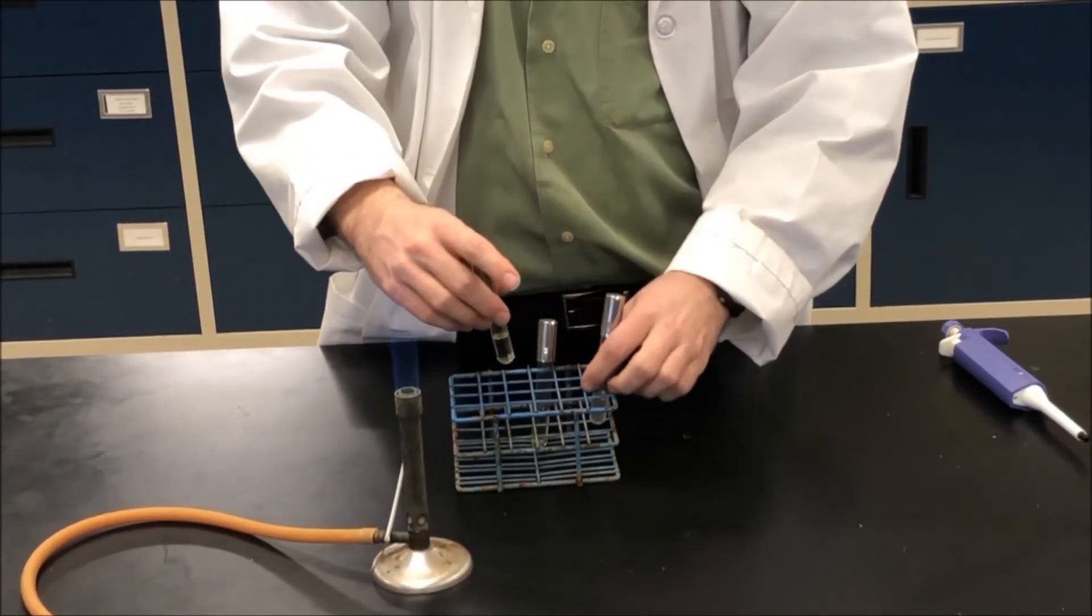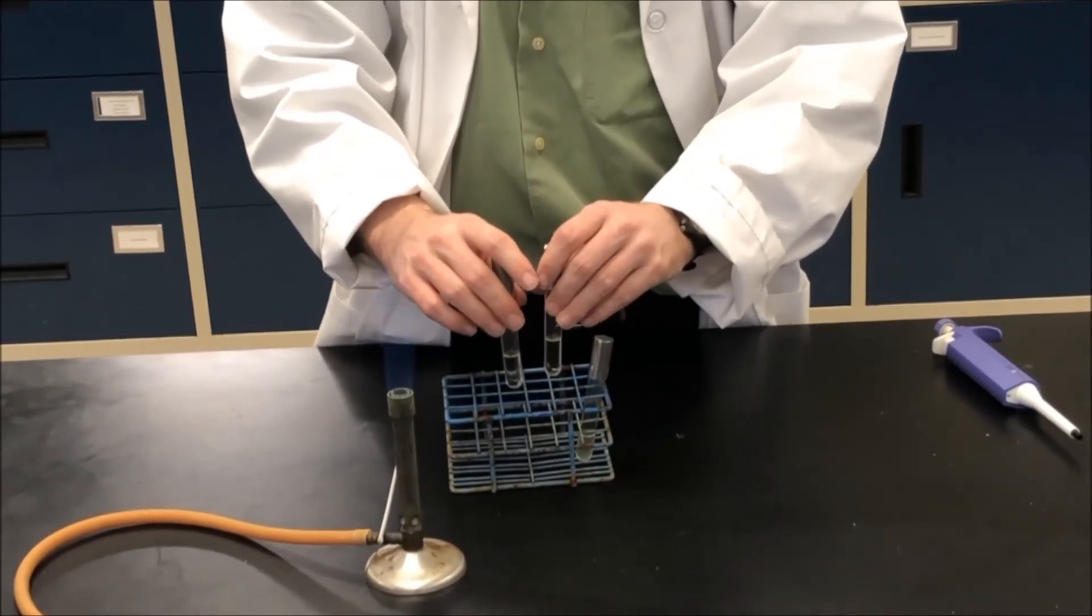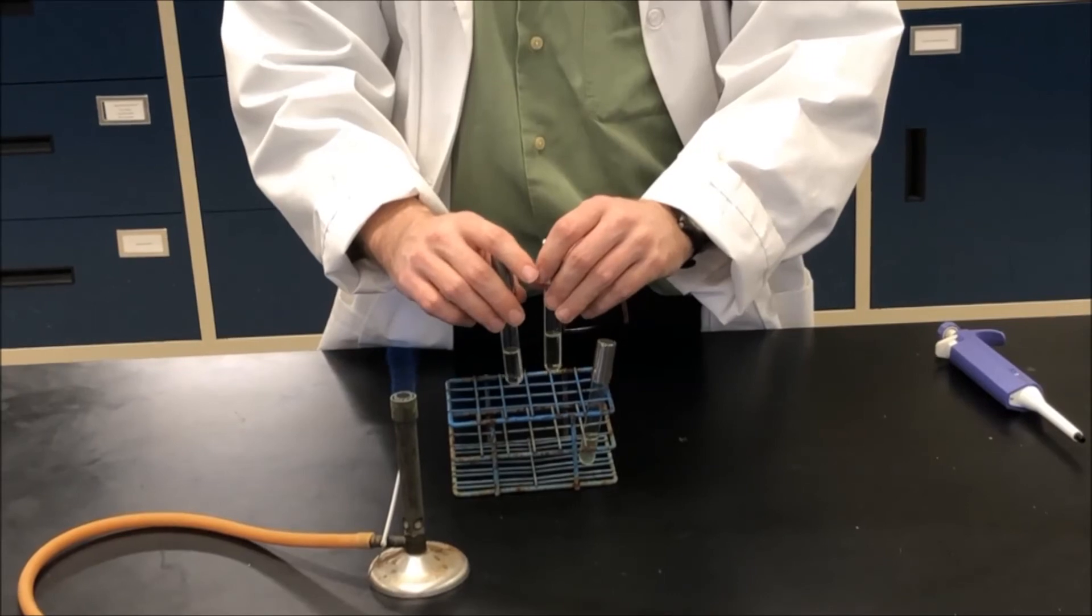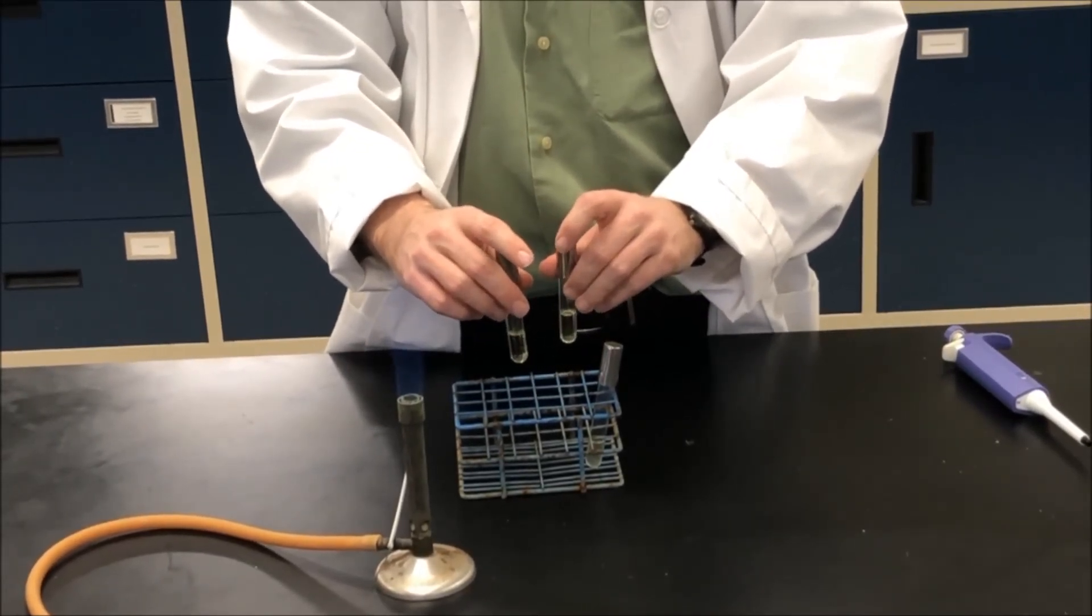After you have your cultures inoculated, you'll want to label them with your name, the bacterium that you just inoculated them with, and then put them at the correct temperature to incubate.